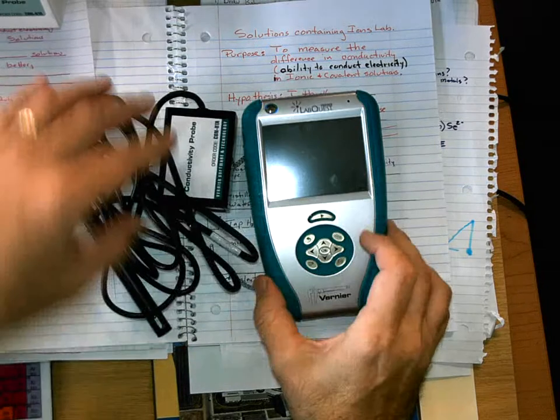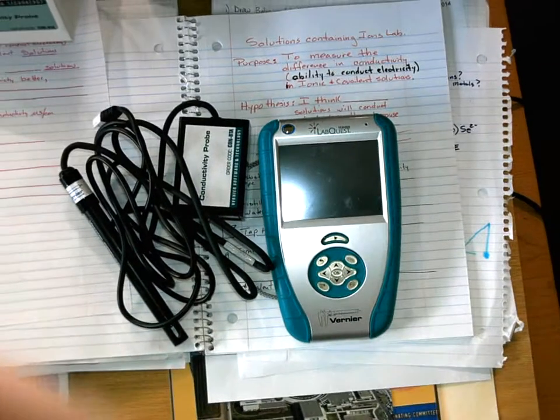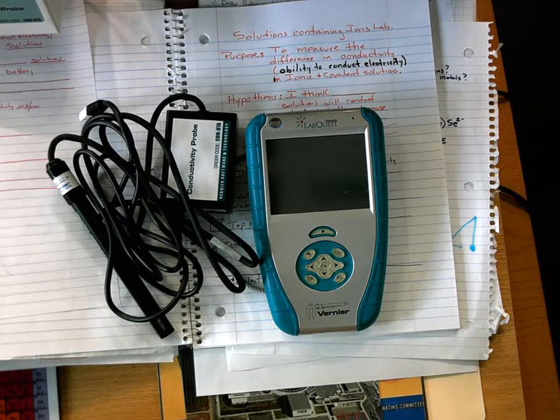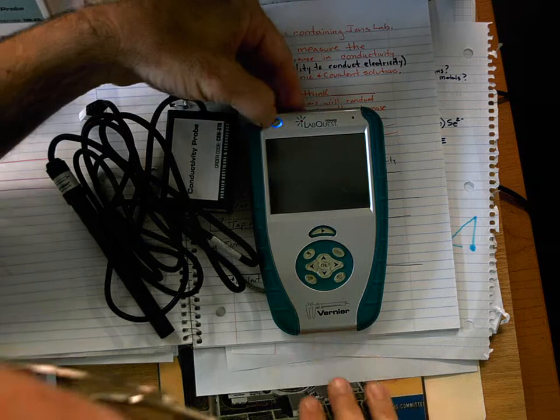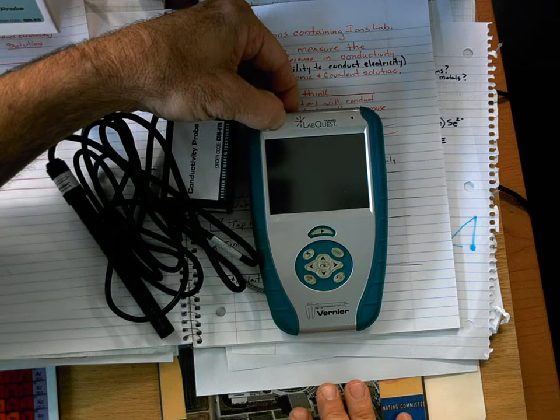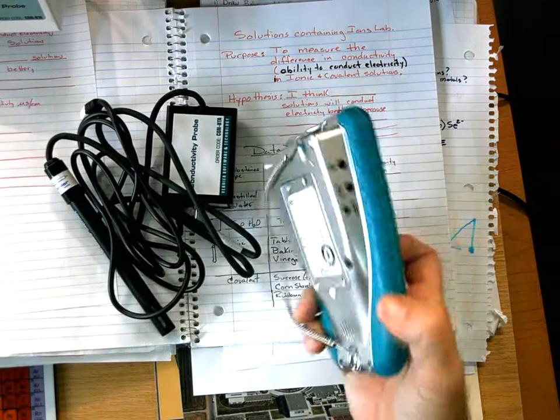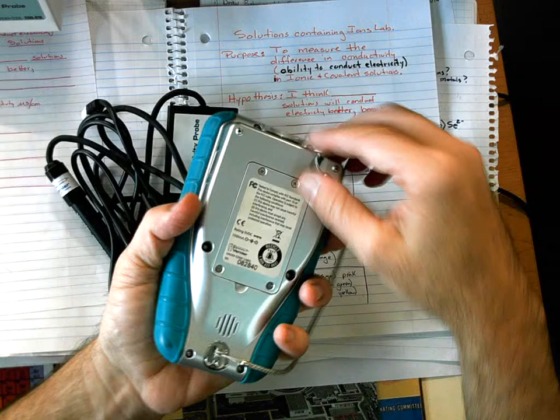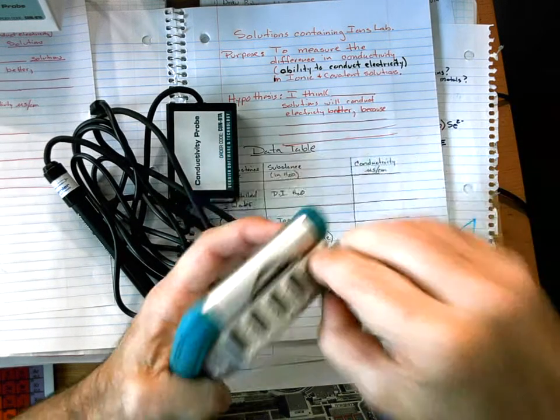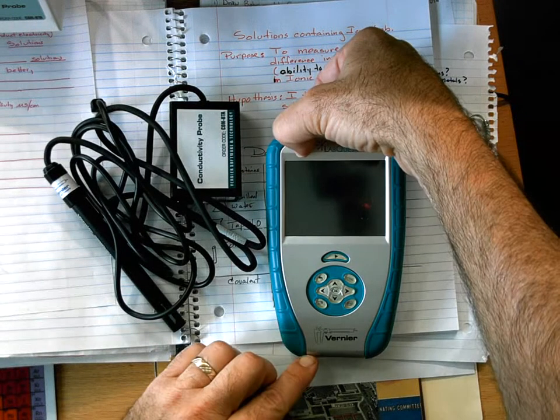What we're going to do first is I'm going to turn off the light here so it doesn't reflect on us. Turn it on right over there, and it should turn on. Hello, are you going to turn on? Did I not hold it long enough? I want to be patient because I know we're all in the instant generation. While we're waiting for it to start, in the back there's a stylus you can pull out. There we go. Come on, turn on.